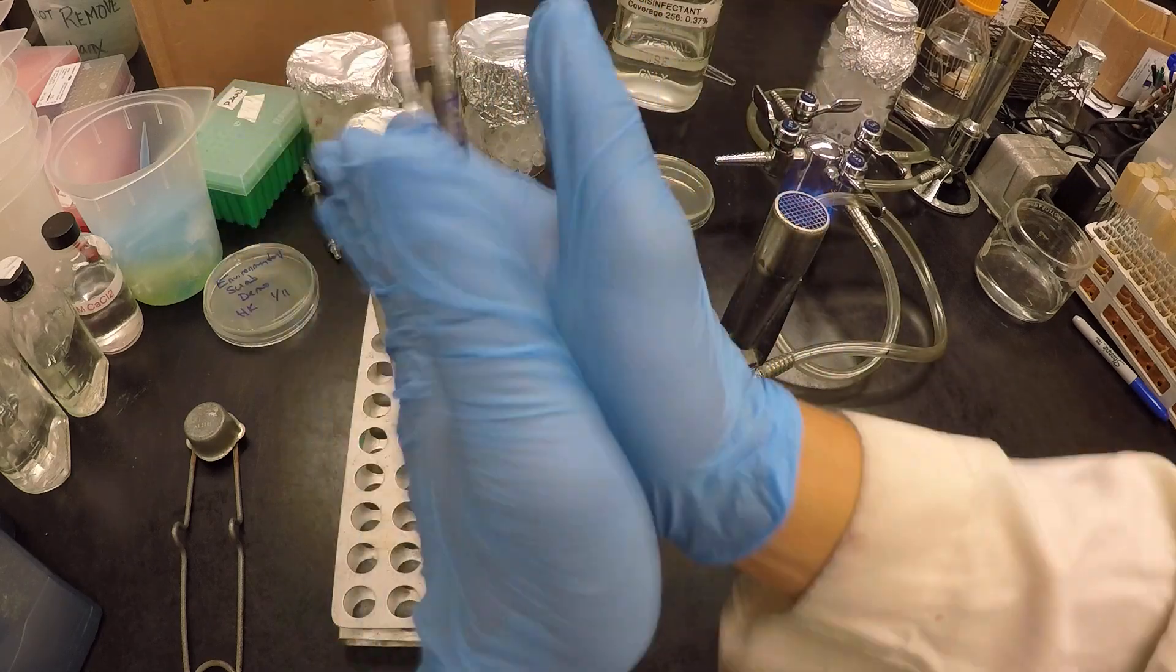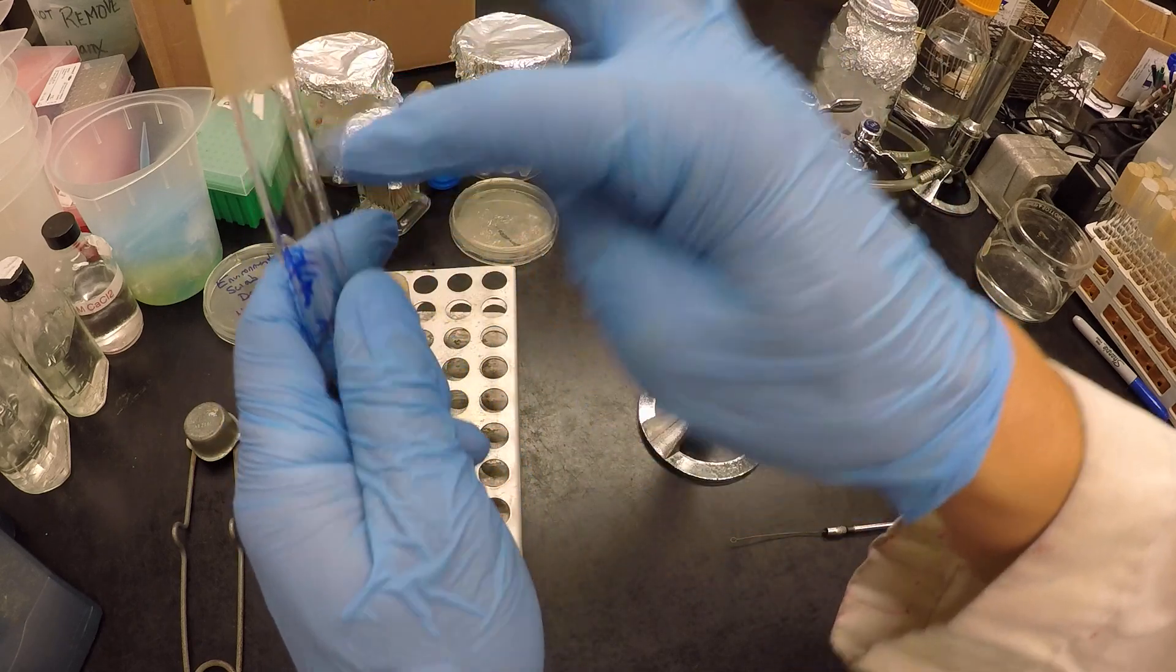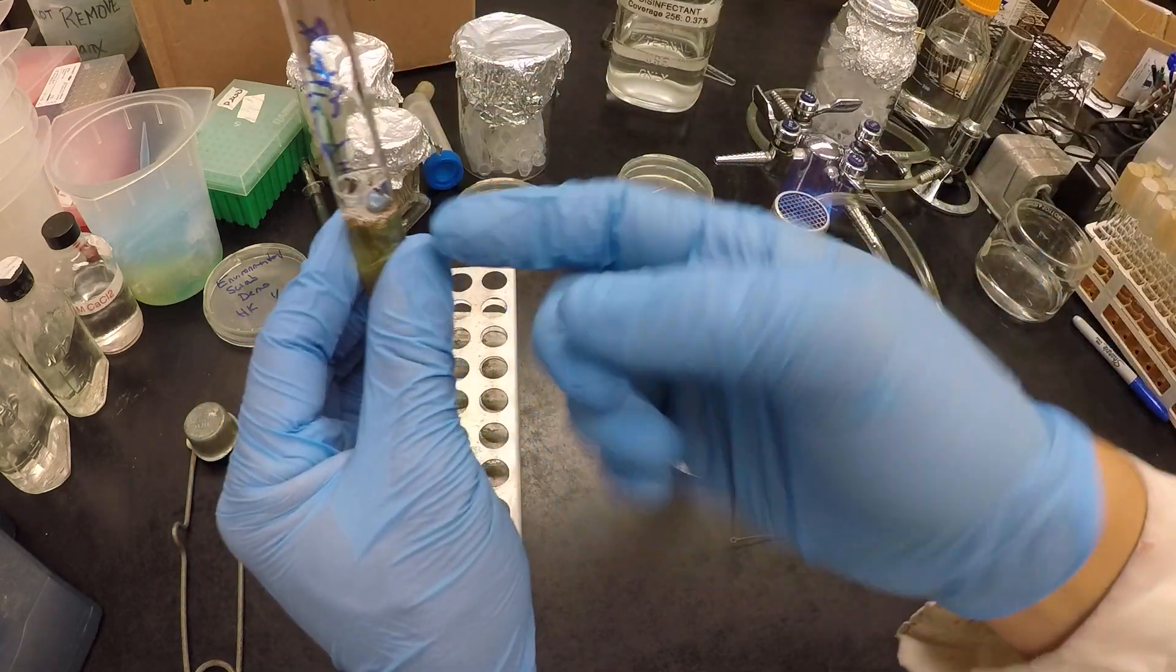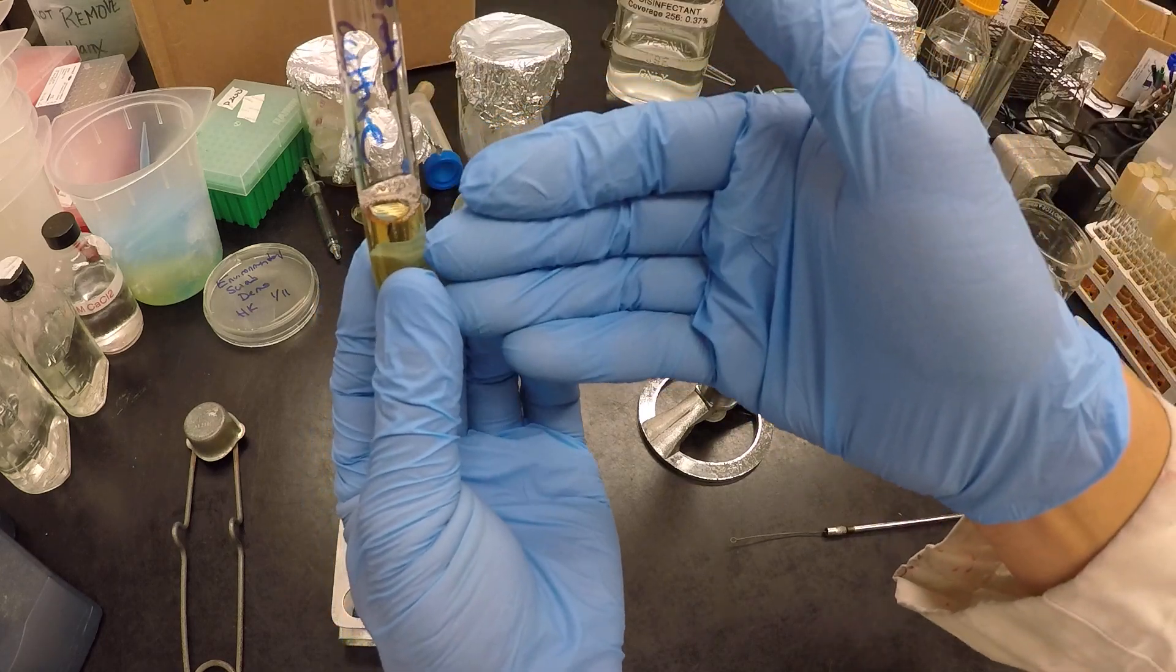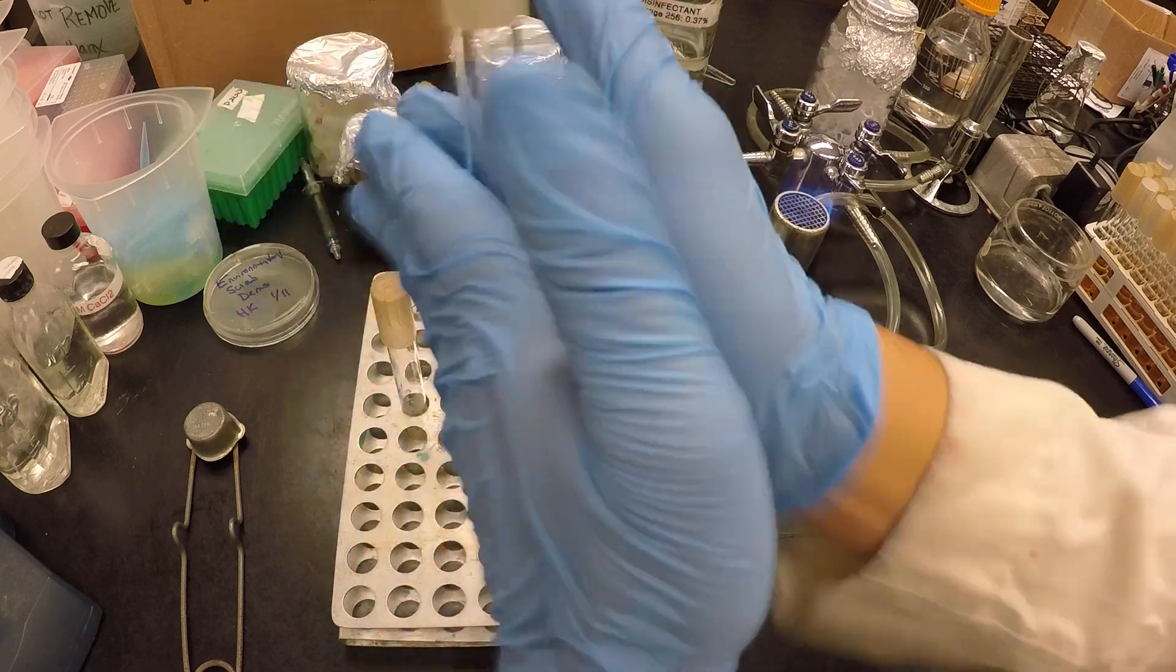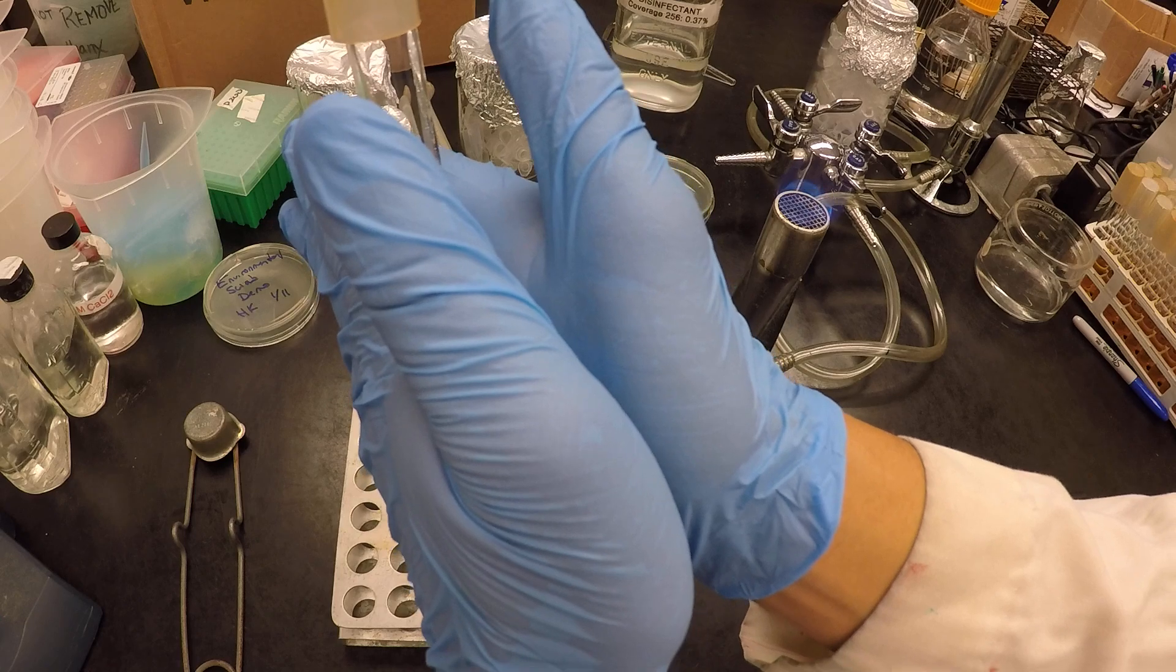And it has a couple of implications. One, there's zero spillage. So especially when the liquid's real high, if we shake like this, it can leak out and over. And again, this is sterile, so it's not a huge deal. But if this were to contain bacteria, that would be a big deal. So this is how we mix. It's safe, effective, and no chance of spilling.